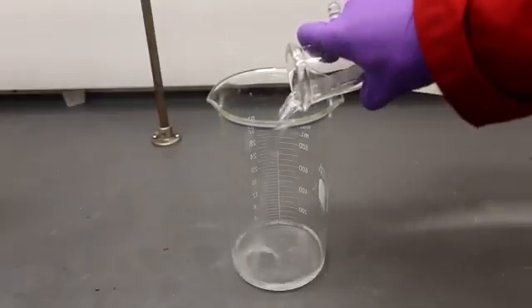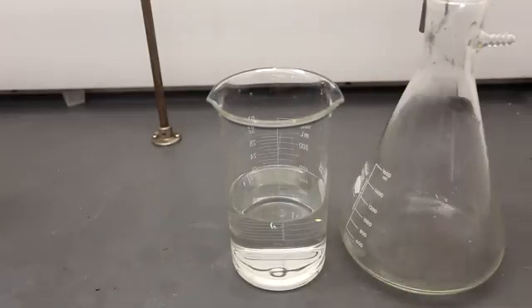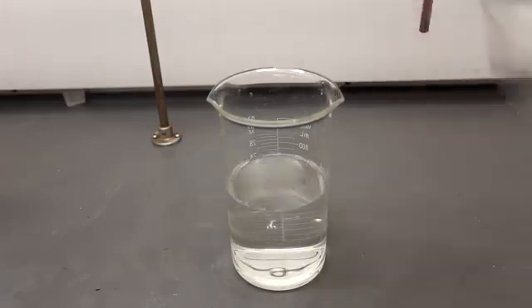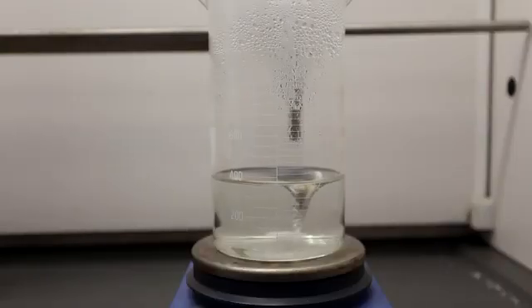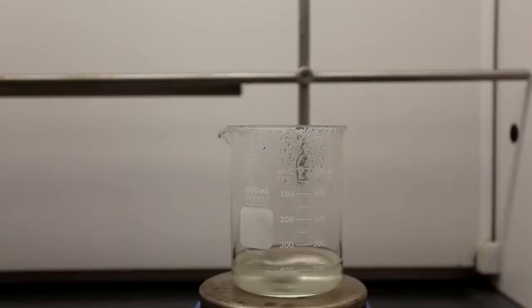The filtrate is transferred to a beaker and the water is gently boiled off. The Erlenmeyer flask was washed twice with about 50 milliliters of water. As the solution was boiled off, it was transferred to progressively smaller beakers. This step takes a long time. Be patient and just keep it at a low heat.